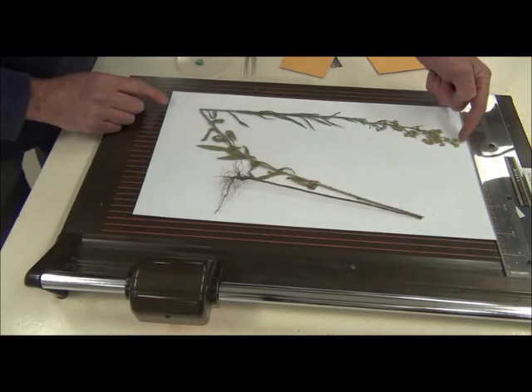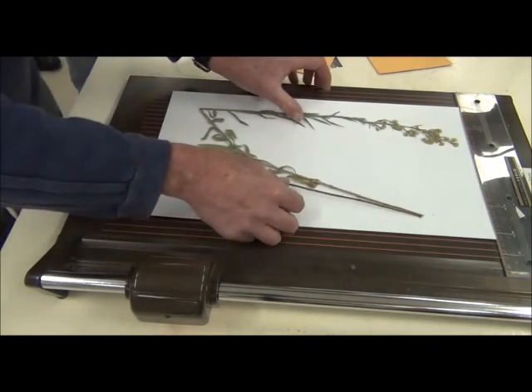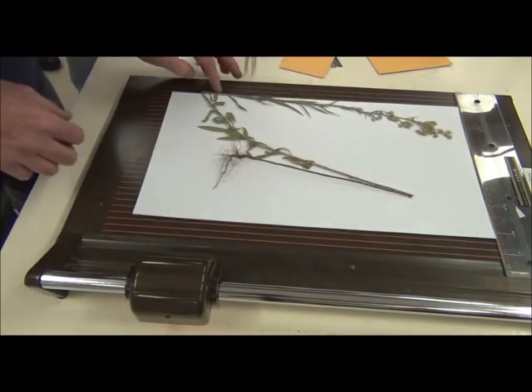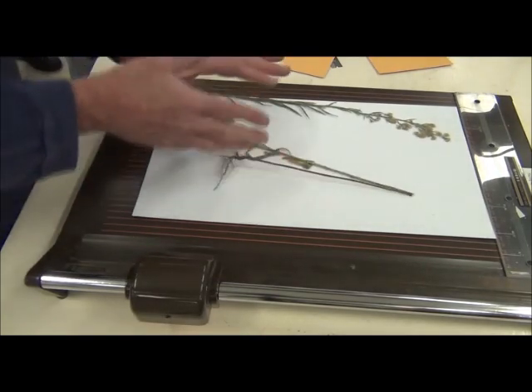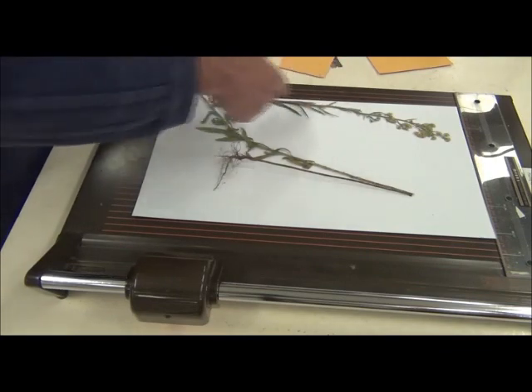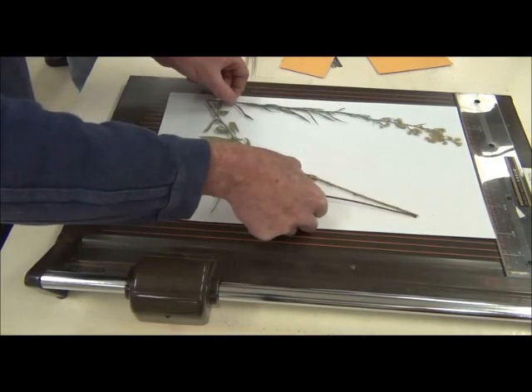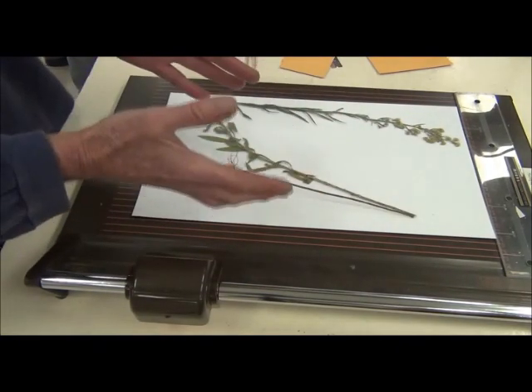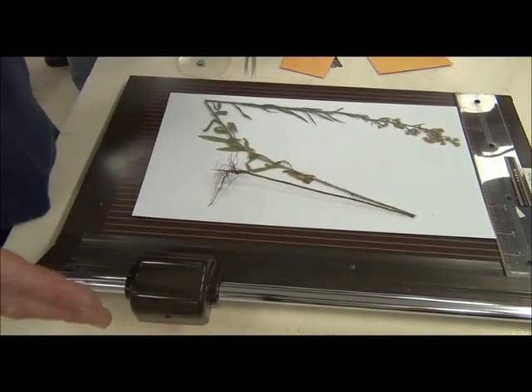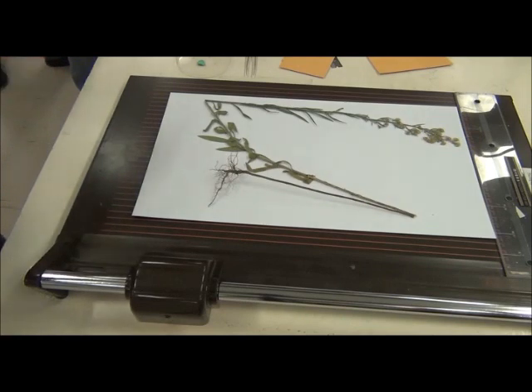Now, I want to keep the specimen away from the edges. There's no point trying to mount it right on the edge to get that root system out from underneath the label because it's only going to get damaged along the edge. So much better that in general if you've got it, use the space. So a couple of centimeters is great, but even if you've got a fairly large specimen, if you can keep it a centimeter away from the edges that's great.